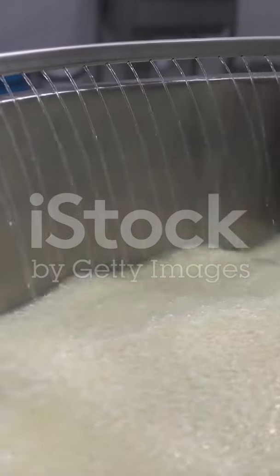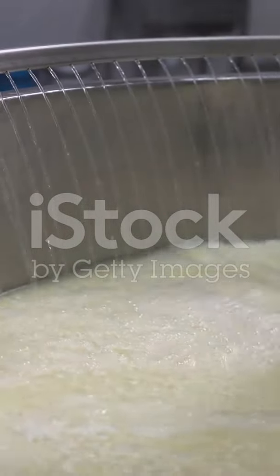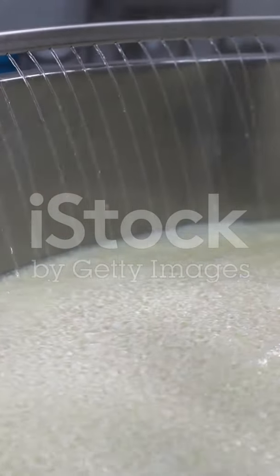Impact of heat treatment. Ultra-high temperature processing denatures the proteins to such an extent that they cannot coagulate with rennet. A coagulation test can verify if milk has been properly pasteurized without being overprocessed.